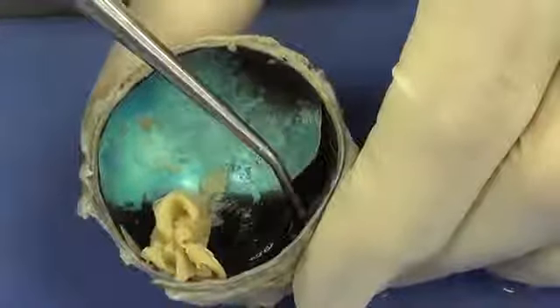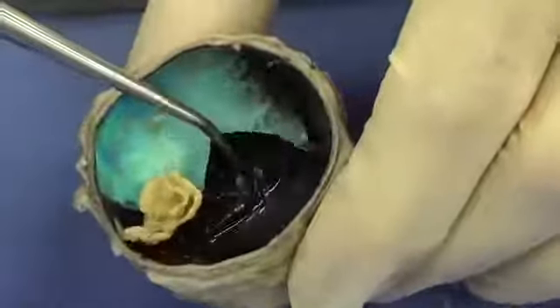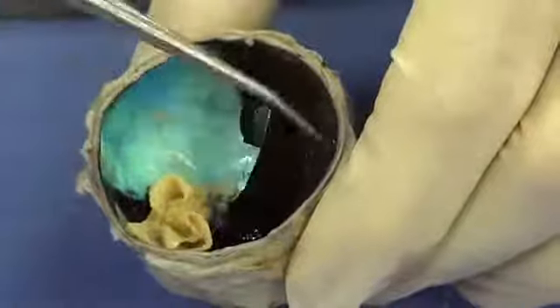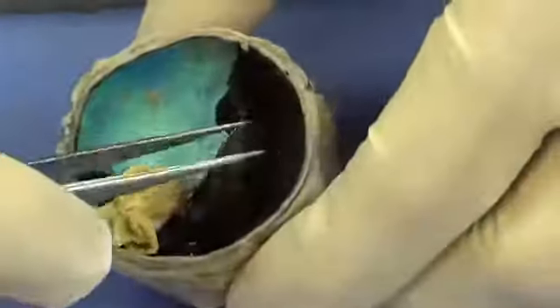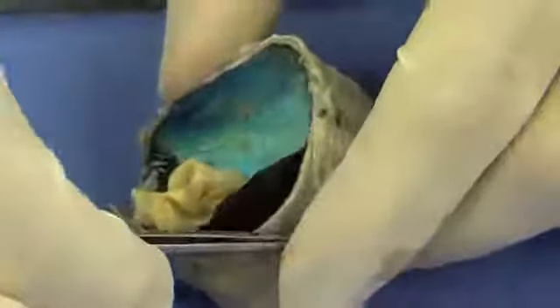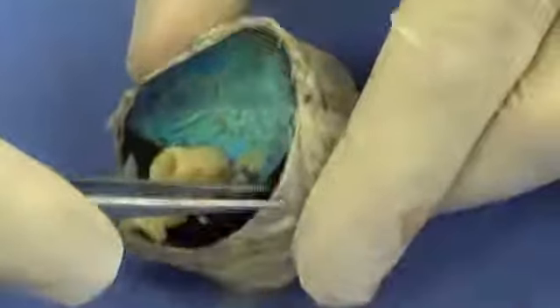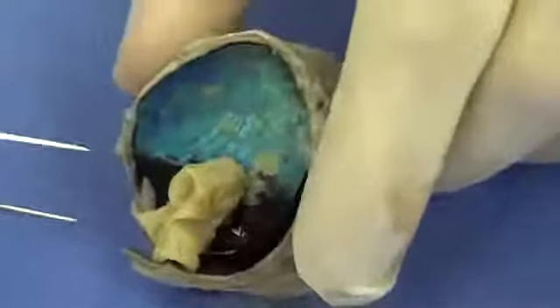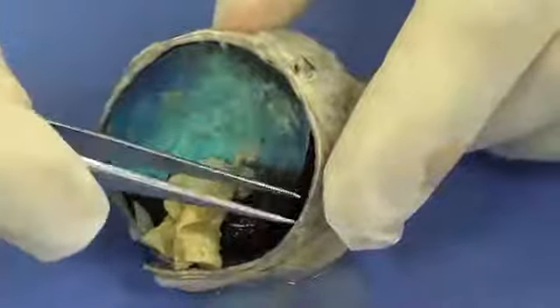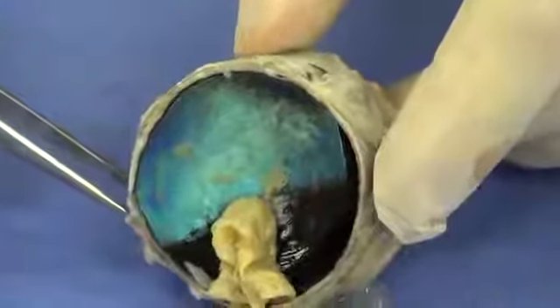Under the choroid is going to be a thick white layer. Now it's stained a little bit black from the choroid, but I'm going to get the forceps in here and you can see how thick it is. I'm going to peel back a little bit of the connective tissue here and you can see this very thick layer. That thick layer is called the sclera, and you can see as I push in on it, it actually springs back to its original shape. Very, very tough material, and that's why we had to hold the scalpel a certain way when we began to cut the eye.